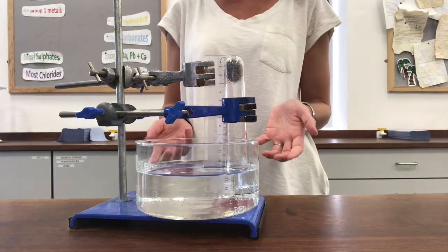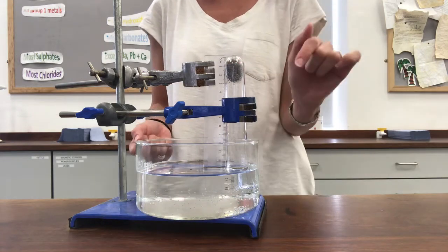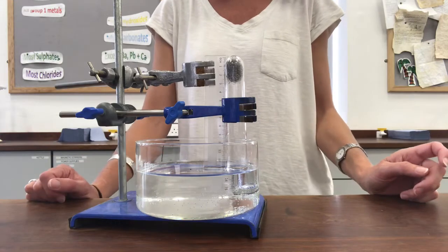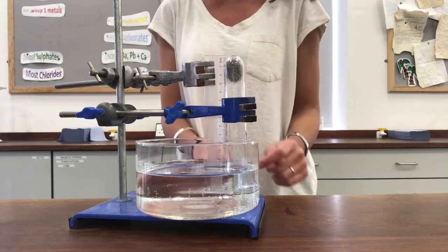I'm going to leave this set up for about a week, and I'm hoping that the iron will rust in the top there. In the process of rusting, it's going to change from iron to iron oxide and use up the oxygen that's in the air in that air bubble.